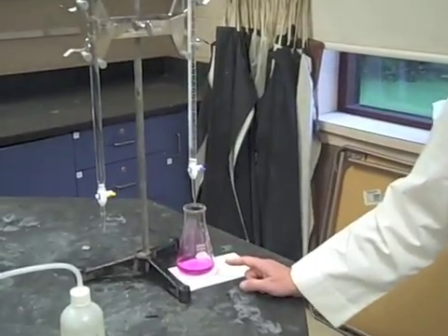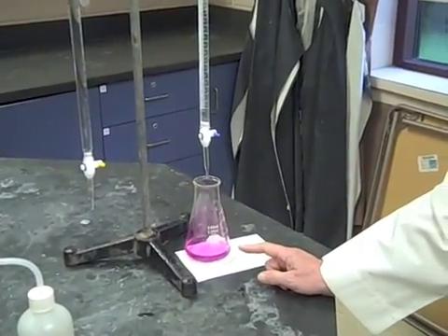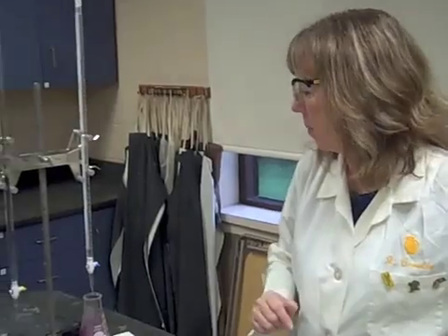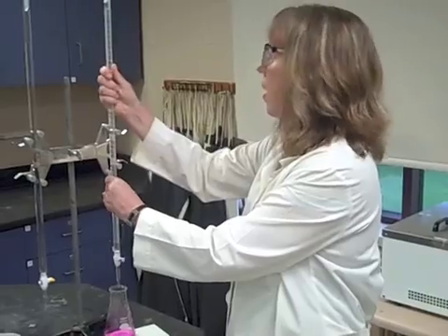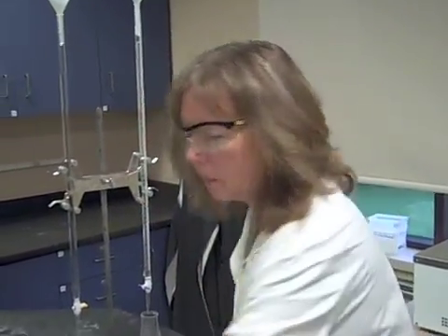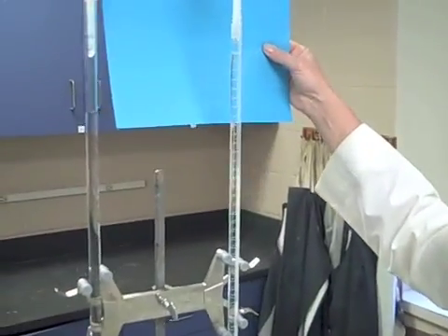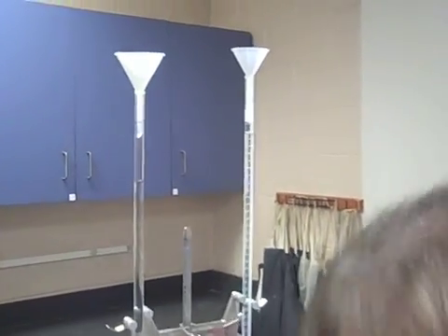And then we're going to do the first calculation with this. So, we're going to go ahead and proceed with this. And then we'll go to part three. We'll have another burette. And we are going to do more calculations based off of the base that we were using. So, here we go. I'm going to take a reading now of this base. And the reading is 2.25.